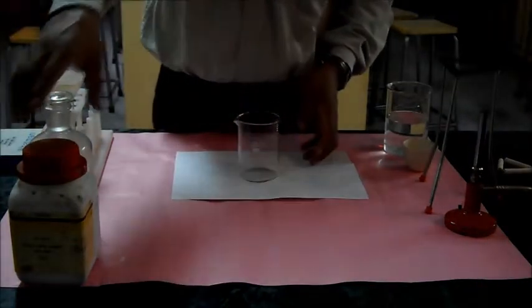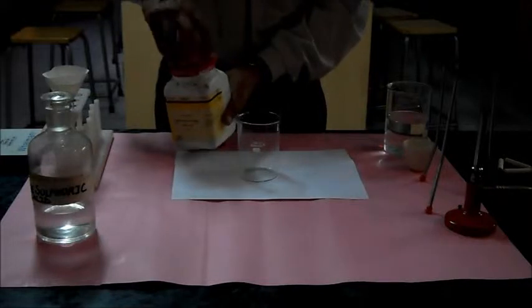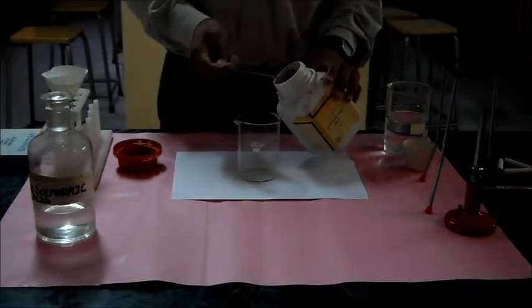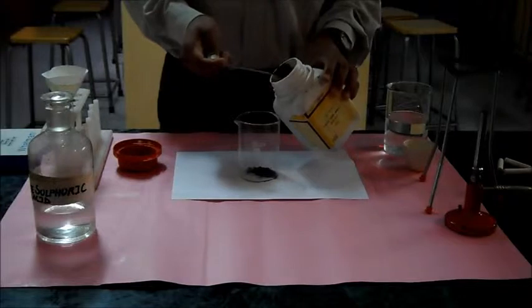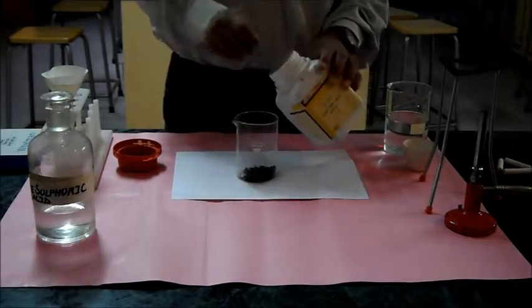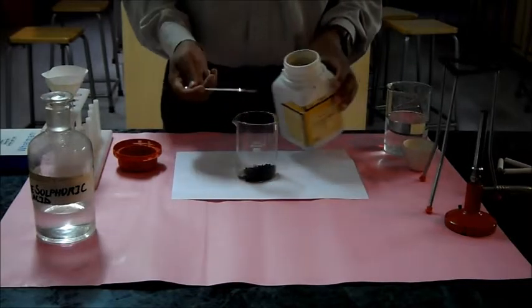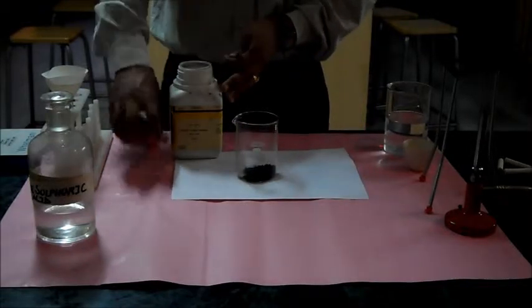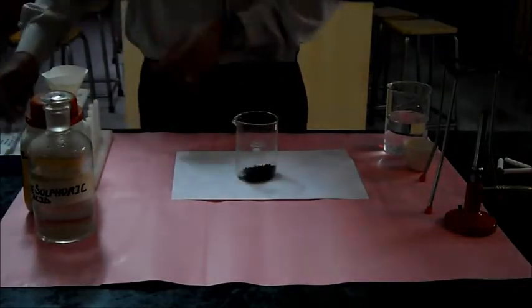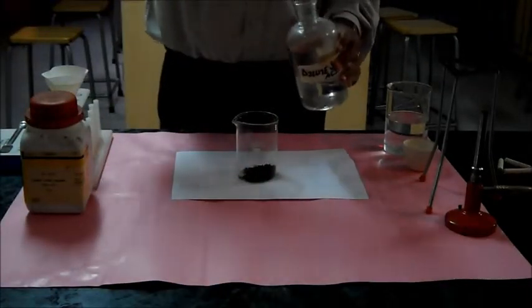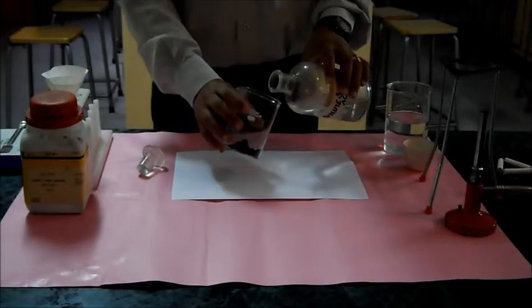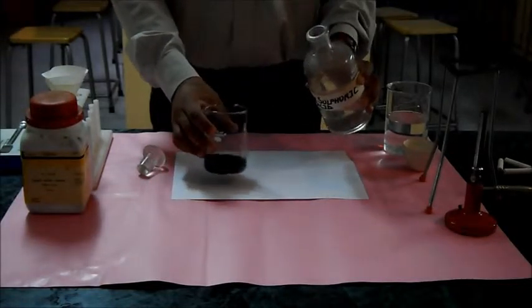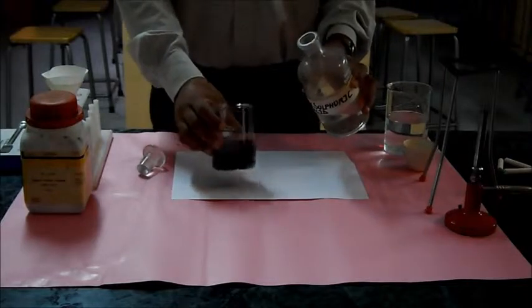Let me begin first with some scoop of copper oxide which is a black color powder. I will take some copper oxide in this beaker, and then pour some sulfuric acid in it. As we pour sulfuric acid, you can see that it mixes in it.